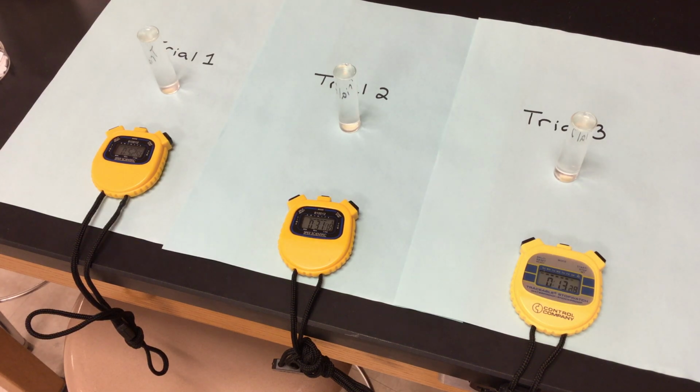I'm going to get some warm water from my yeast here, so that it can be happy as it's sitting there. The colder it gets, the less it's going to want to grow and ferment. So we're going to make sure it's nice and warm throughout this process. So remember, 4 minutes is going to be my maximum time that we have here. If nothing happens within those 4 minutes, we're going to go ahead and just say 4 minutes. So while we're waiting, my little yeast is going to be going in some warm solution.